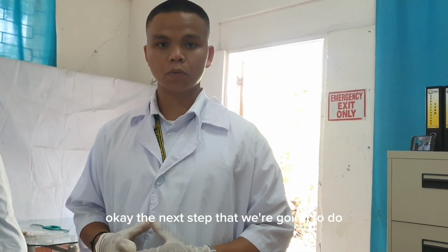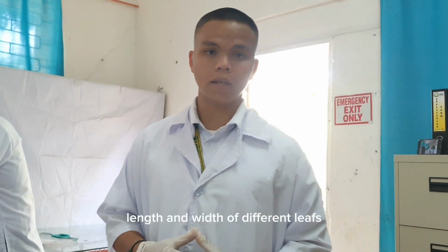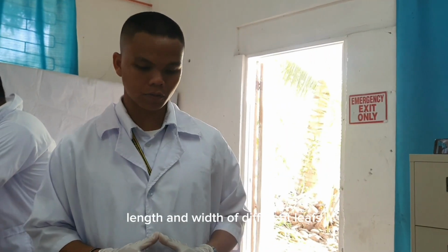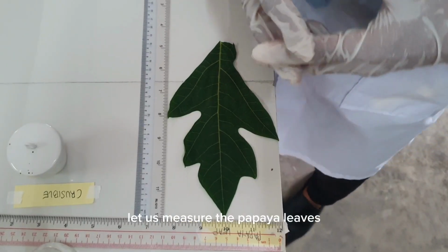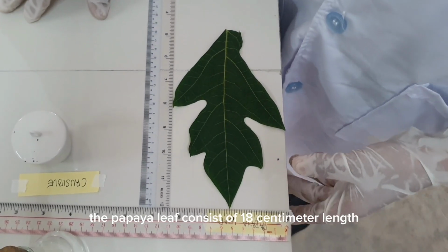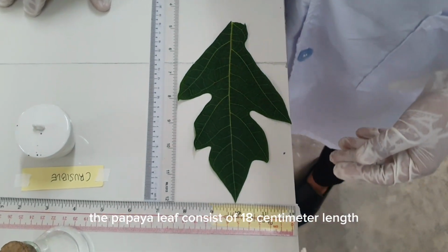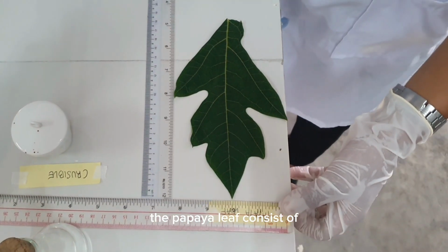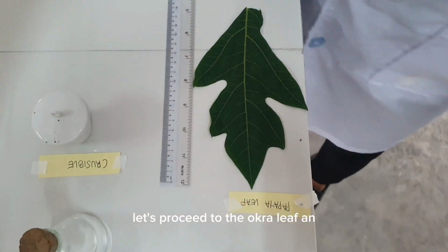Okay, the next step that we're going to do is measure the length and width of the different leaves. Let us measure the papaya leaf. A papaya leaf consists of 18 centimeter length and 12 centimeter width. Let's proceed to the okra leaf.